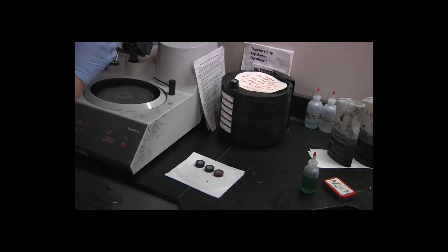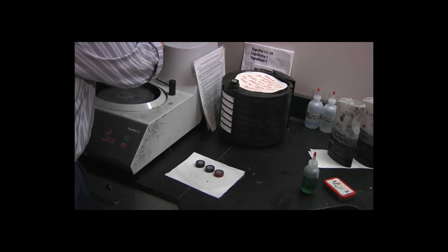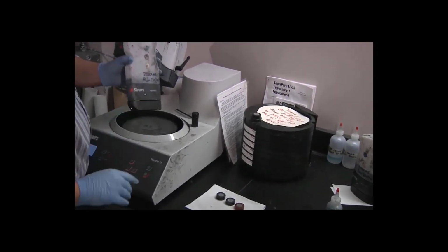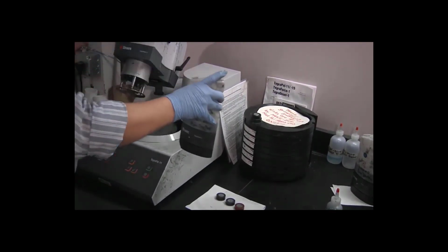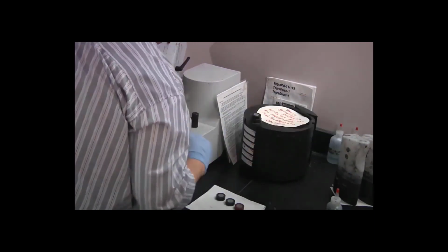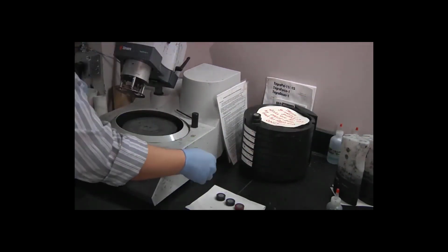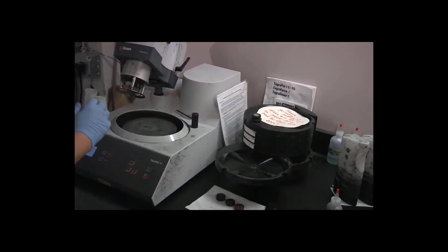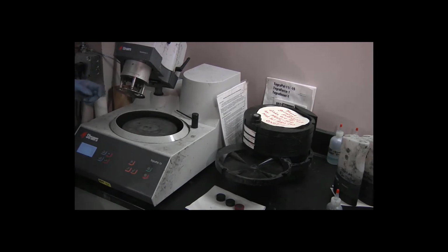So now I need to unload the doser bottle, swing the bottom out, lift straight up, bring the bottom back to flush, and replace it in its storage position. I want to put the polishing disc back. Again, the diamond grit does not wear out, so I don't want to rinse it off. I want to leave that material on the disc.